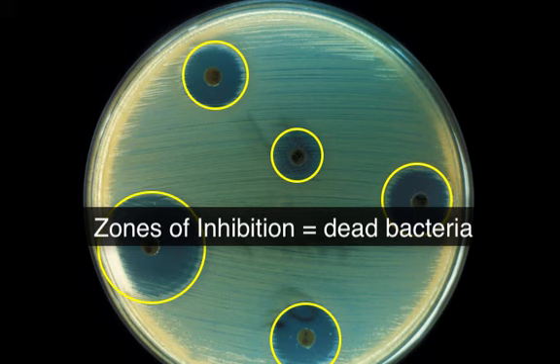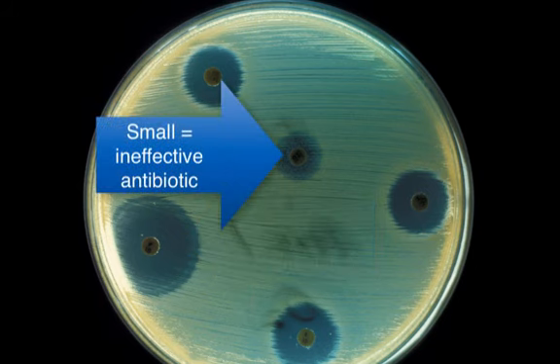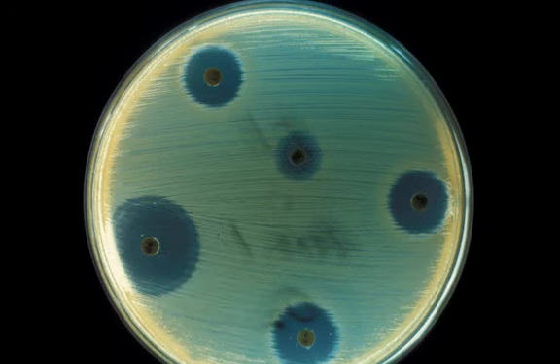And this indicates to us that the bacteria is not growing. It's been killed by the antibiotic. So the larger the zone of inhibition, the more bacteria that has been killed. The smaller the zone of inhibition, the fewer bacteria have been killed. So we're going to measure the diameter of the zone of inhibition to determine the effectiveness of each different type of antibiotic on E. coli and B. cereus.